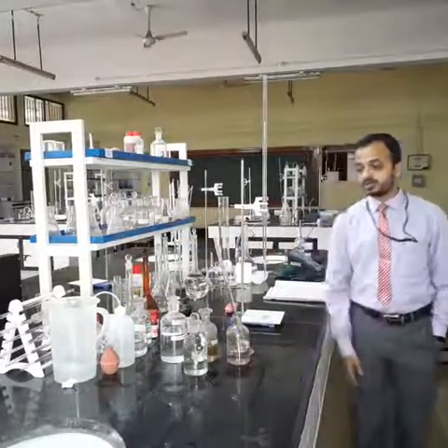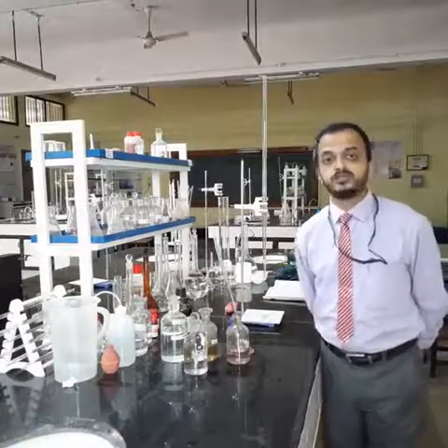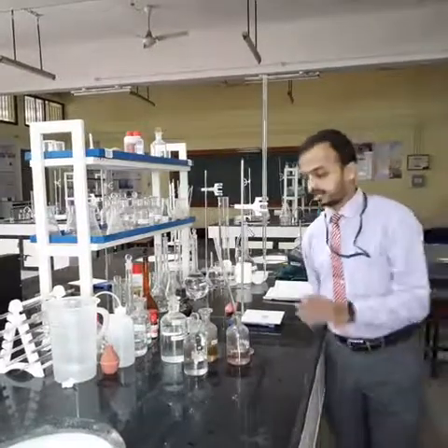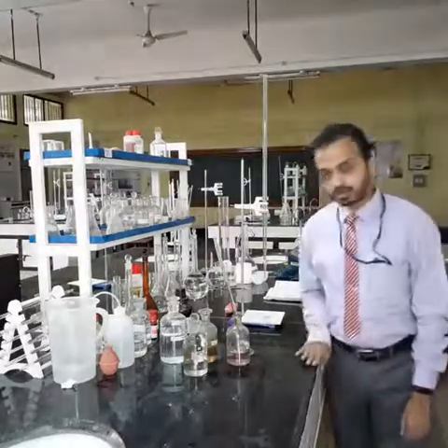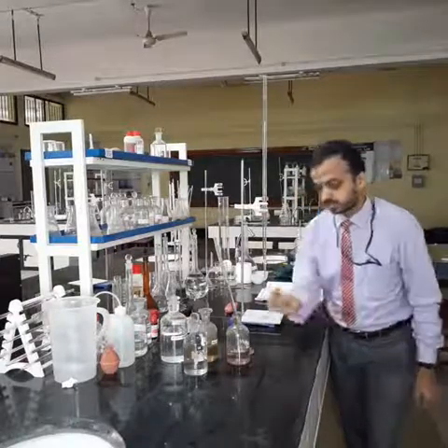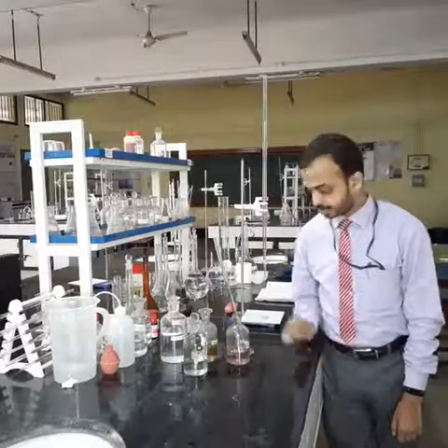So in order to understand whether the sewage is septic or not, you need to find out the dissolved oxygen present in the sewage. Here I am not going to take a sewage sample but a water sample to determine the dissolved oxygen present in the given sample. To proceed with the experiment, you first need to know what chemicals or reagents are used to carry out this test.